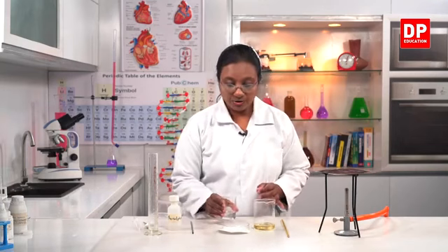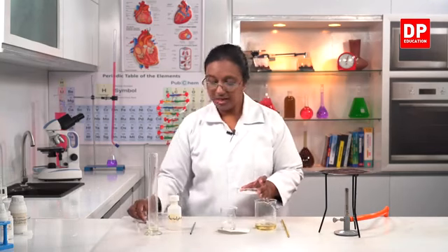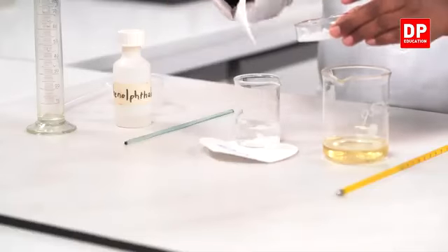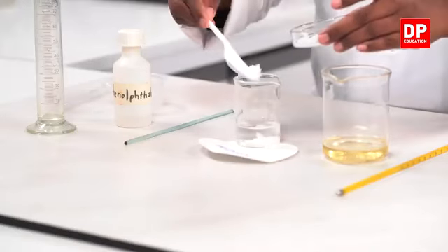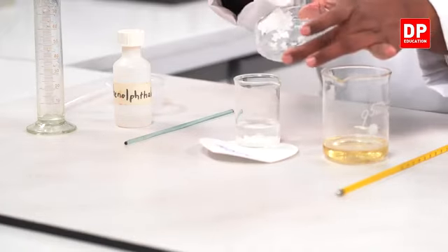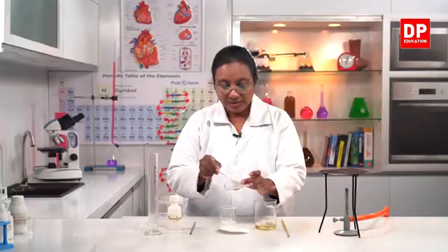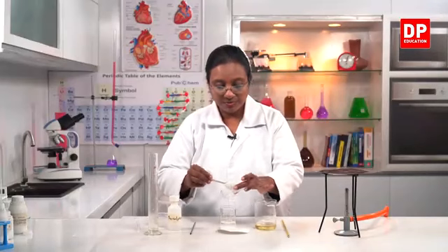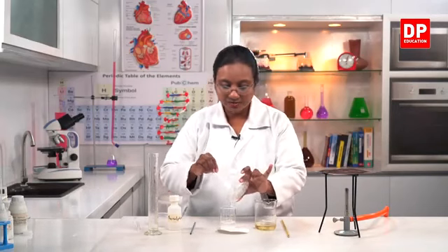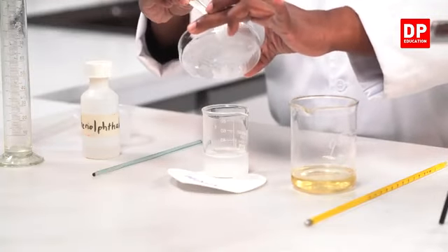So, what I am going to do is, I am going to transfer the sodium hydroxide into this and dissolve it completely. Here you can see, students, normally sodium hydroxide bases become slimy. You can observe that slimy nature here. They become a little watery, mainly slimy.